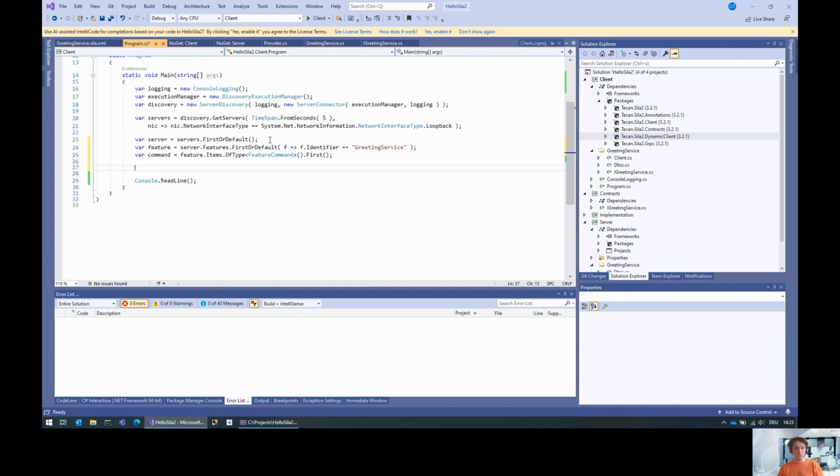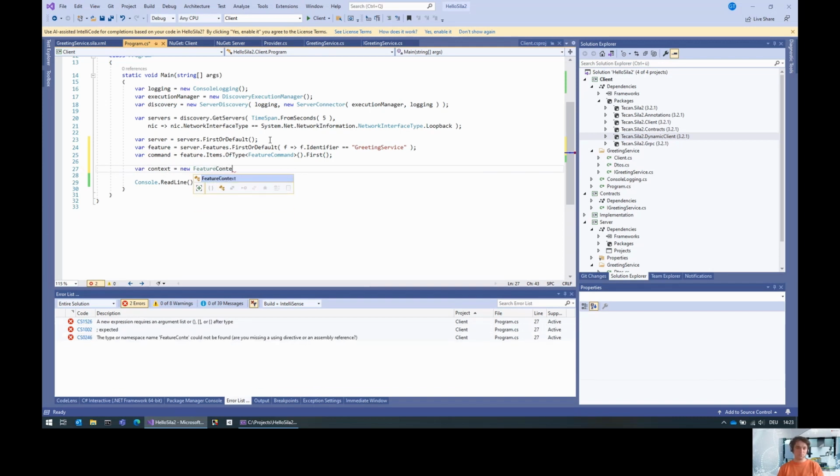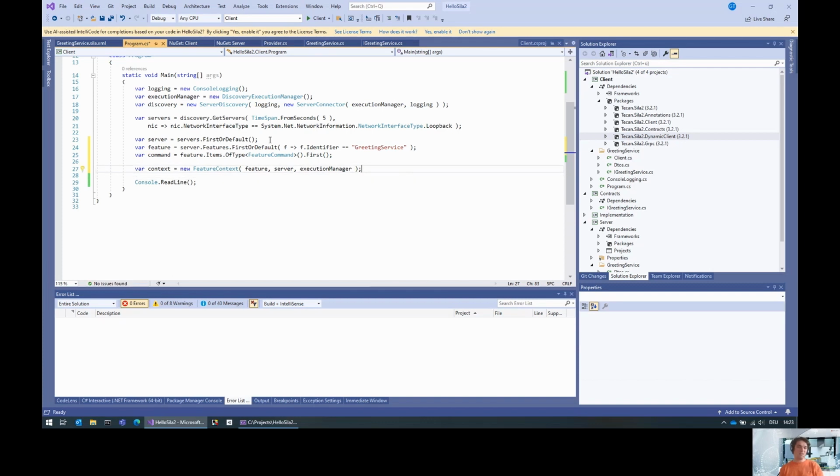Now what we basically do is we first need to create a feature context, a new feature context for this feature with this server and this execution manager. This basically means: what do you do in the context of this feature? It is used to resolve data types, because in a feature you can provide data types as a reference to other custom data types that are defined in the feature, and therefore we need a bit of context.